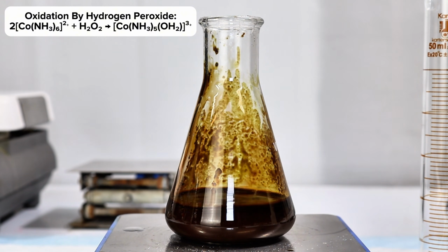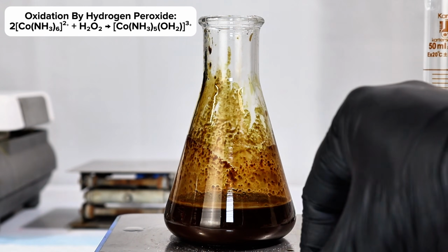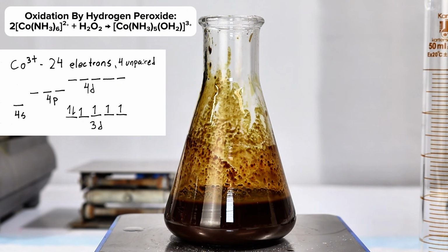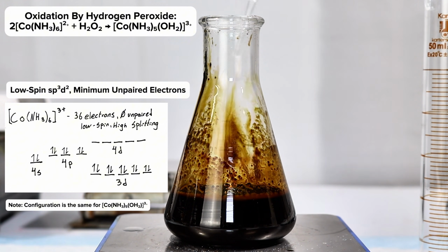What happened in this second reaction is that the peroxide oxidized the cobalt to the +3 state, which is ordinarily very unstable. However, when complexed with ammonia or another strong ligand, the new 3d6 configuration of cobalt allows additional ammonia to complex to the 3d orbital, leaving no unpaired electrons. This new configuration is thus fairly stable.